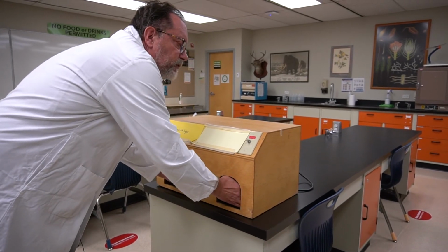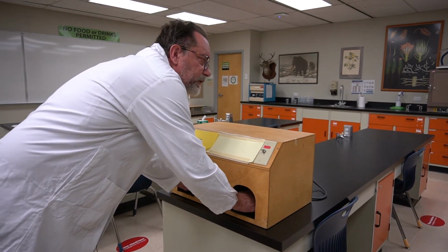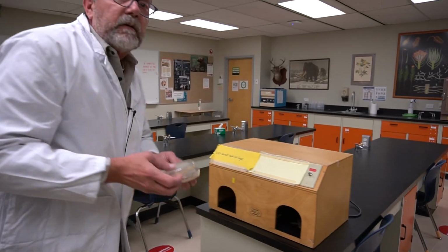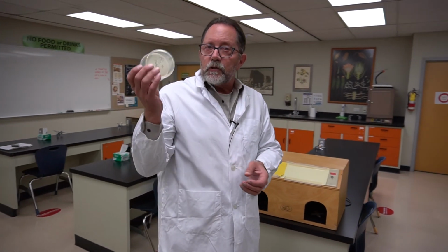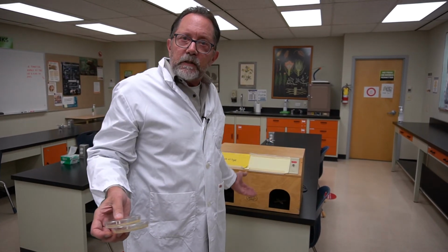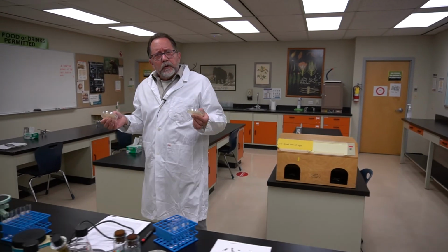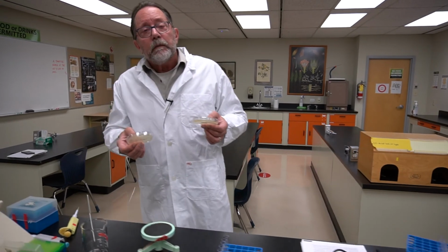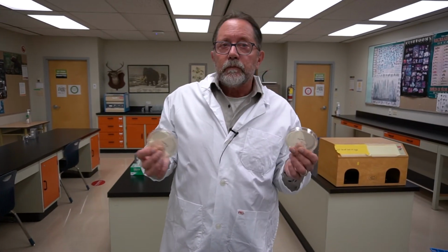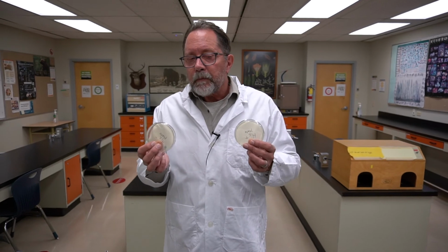I would take the lids off, 1, 2, 3, 4, 5, put the lids back on, and take the plates out. These now have been dosed at 5 seconds each, and you'd put in your 10-second plates, 20 and 30 as well. These would then go into incubation. They're rather slow growing. We'd grow them at about 25 degrees in the incubator for at least 4 or 5 days until the colonies come up.